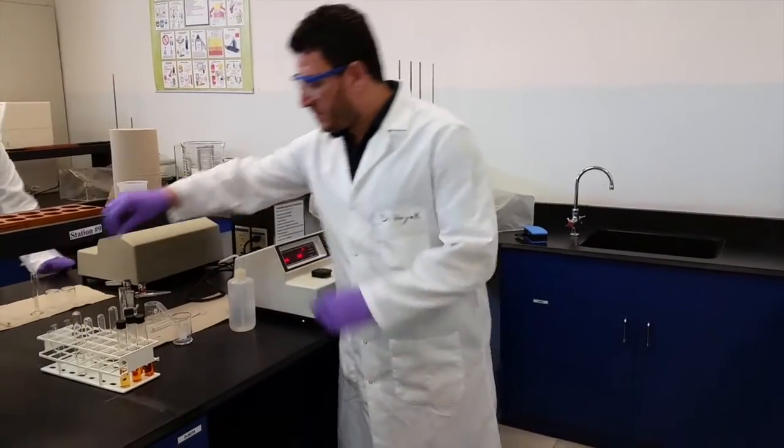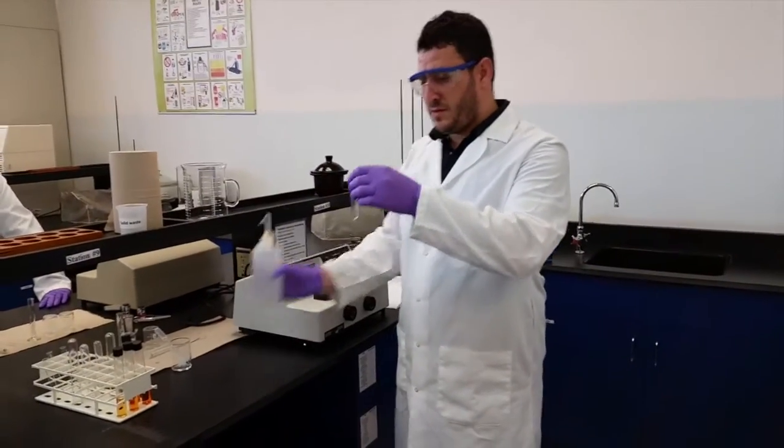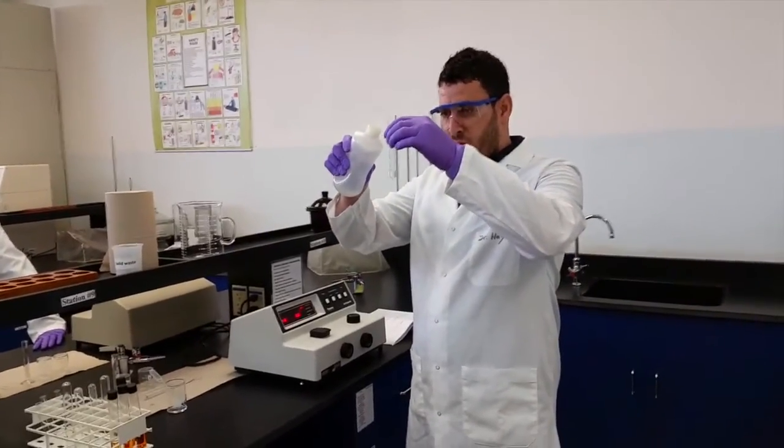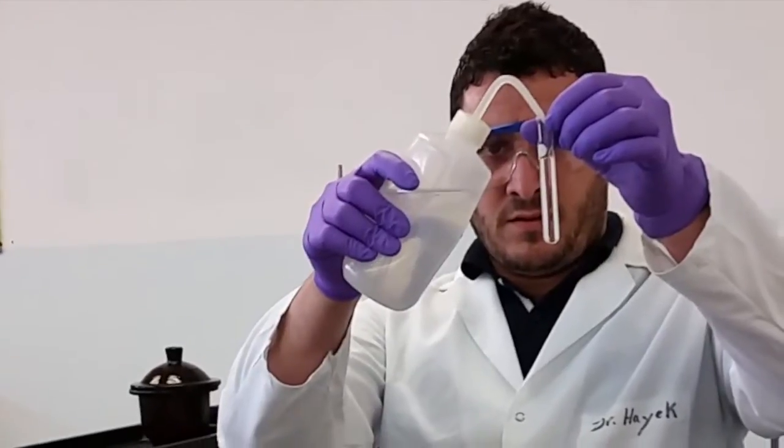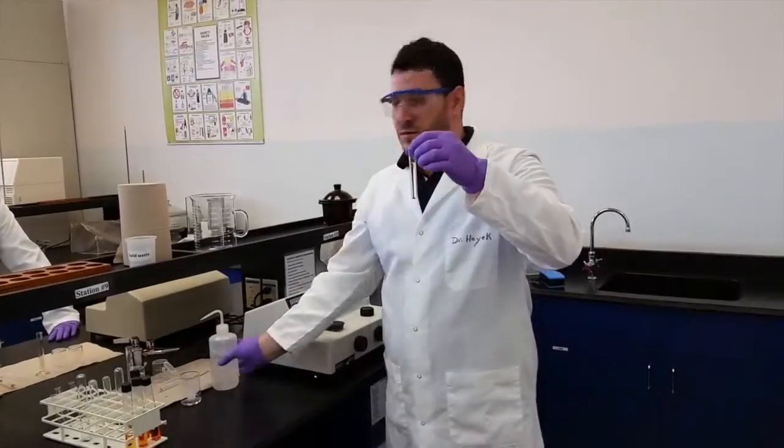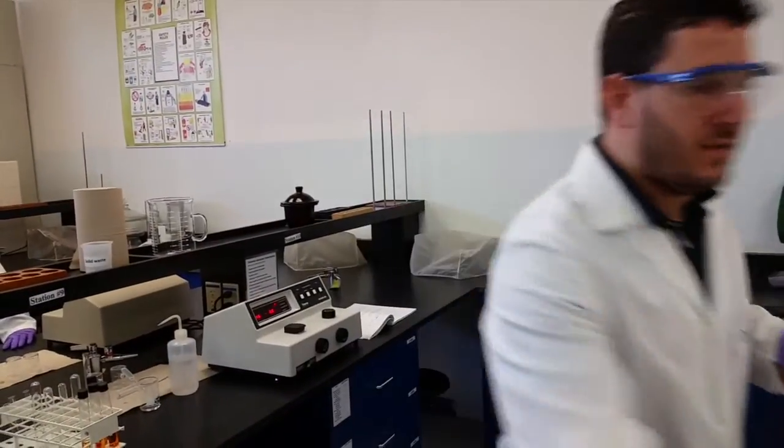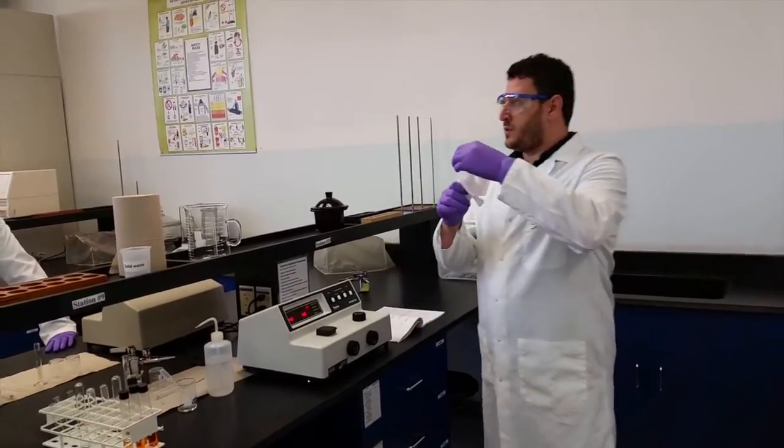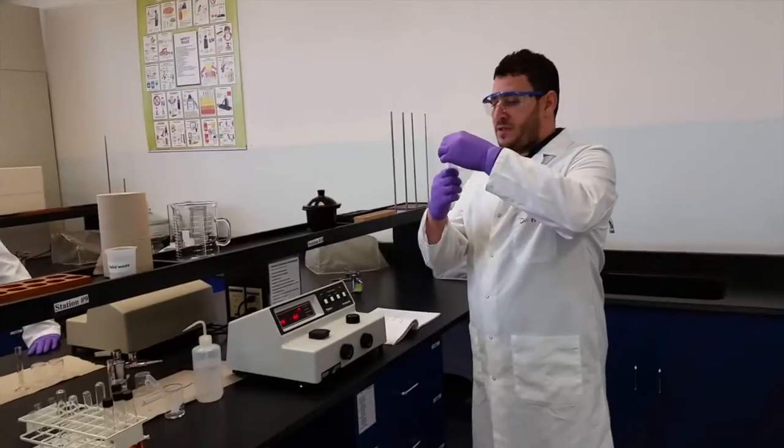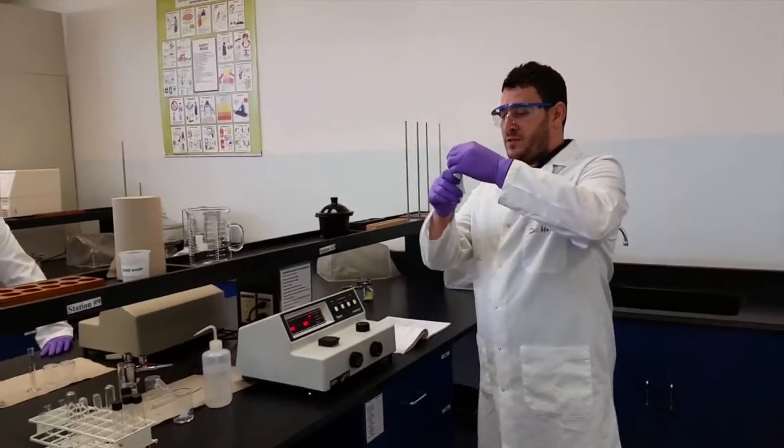Take one of the test tubes and fill it with water until the white mark. Make sure you don't have fingerprints, water, or any kind of dirtiness on the tube.